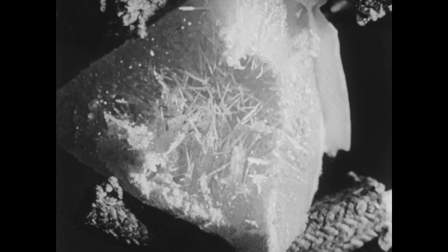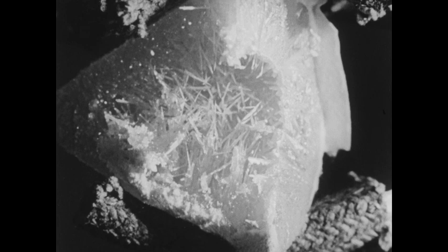This mass was then removed from the funnel and broken in half so that you could see the many needle-like crystals of monoclinic sulfur, which had formed inside the funnel. Monoclinic sulfur is the stable form at temperatures above about 95 or 96 degrees. And since the melted sulfur was above this temperature and began to solidify above this temperature, monoclinic crystals were formed.